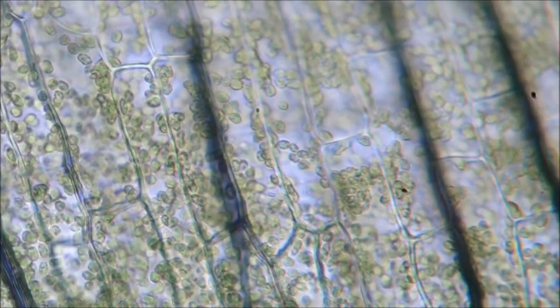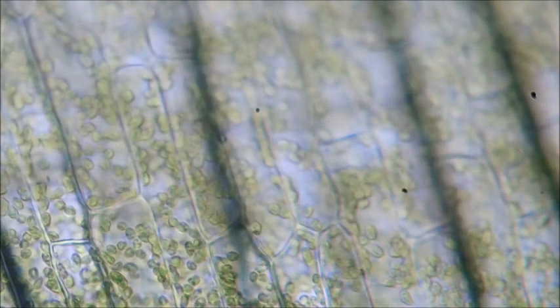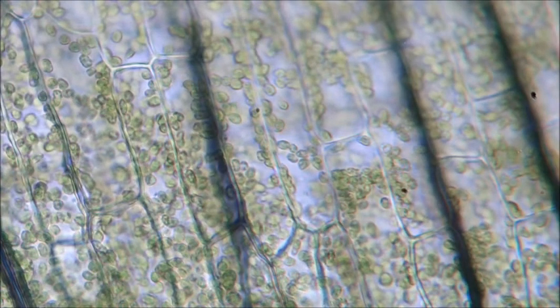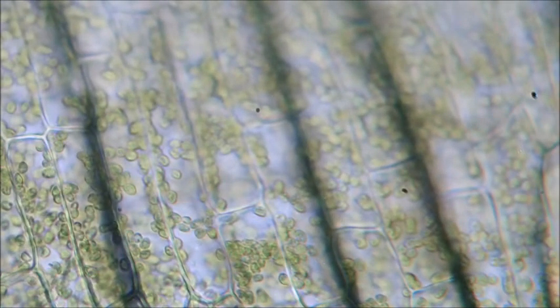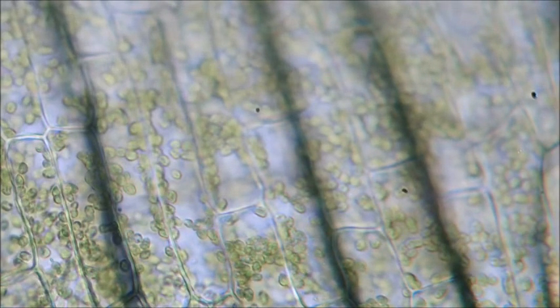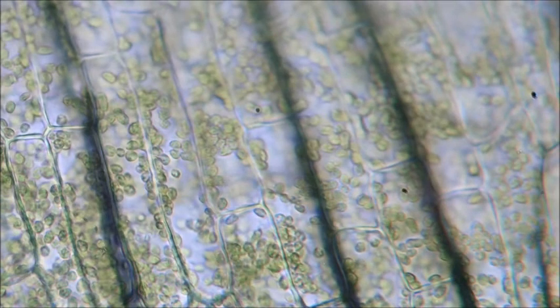But can you see those mites? There are mites in there. And I have been wondering why my Elodea is not growing. And I think we have figured it out right now. There are actually tiny mites inside the cells. It's mind-blowing. There you go. There's some more cytoplasmic streaming with the chloroplasts. Oh, it's so beautiful. Looks like those mites are inside the chloroplasts, eating them. Oh my gosh.